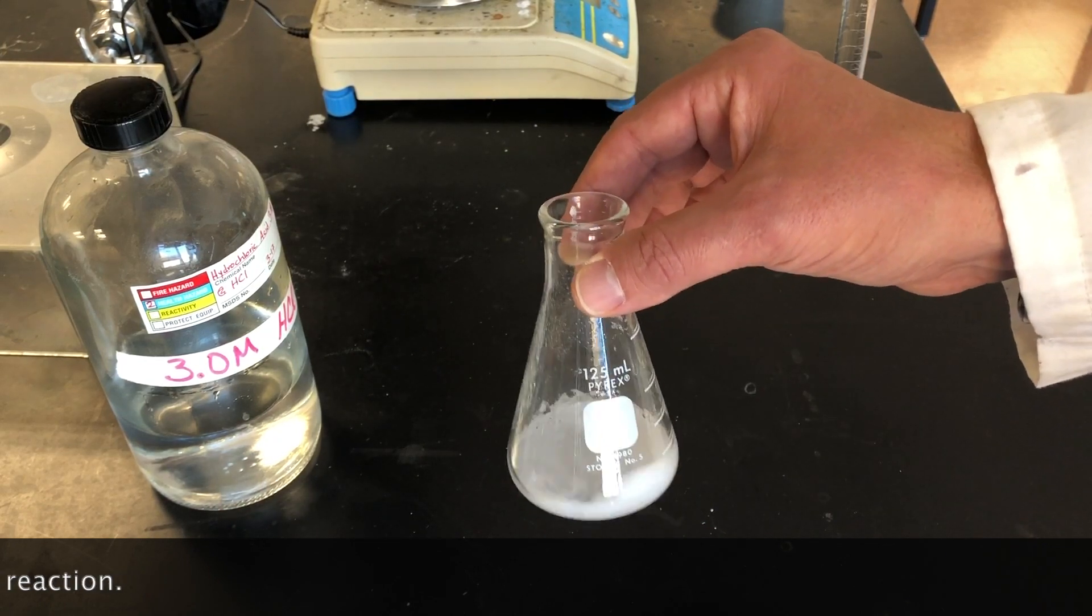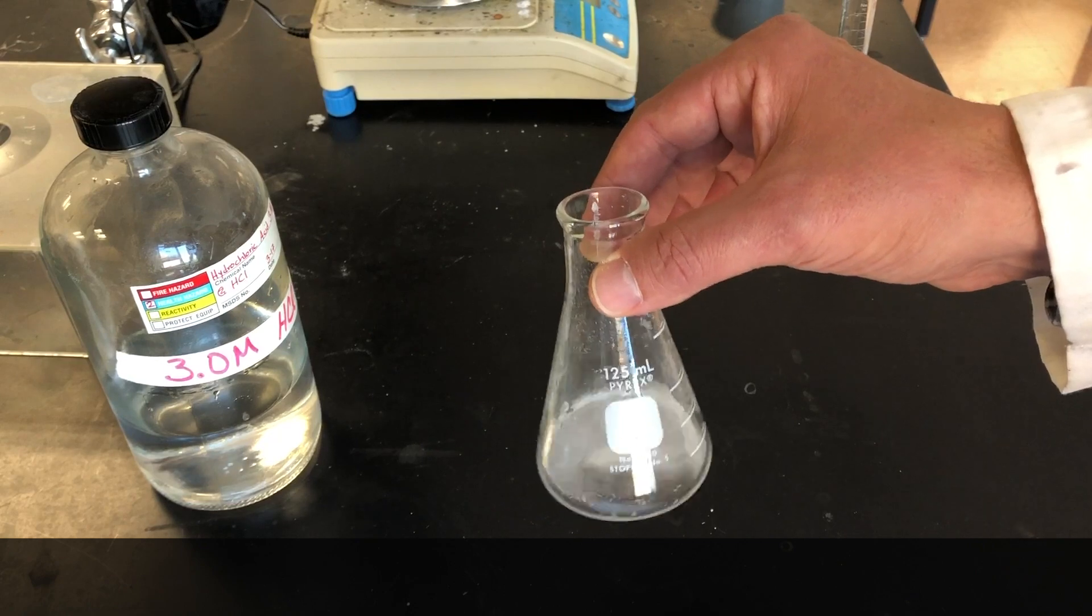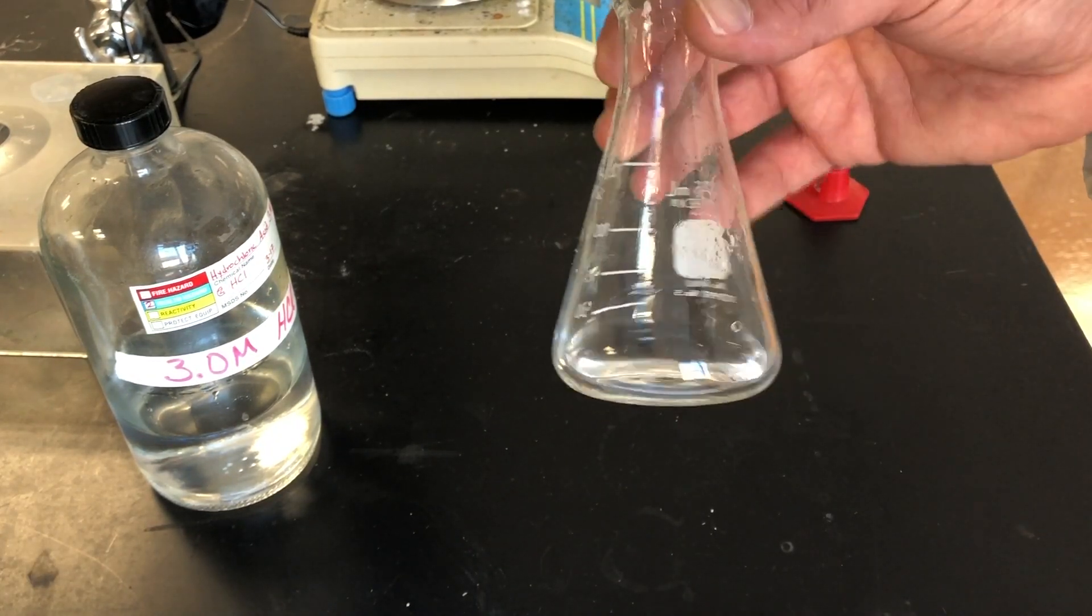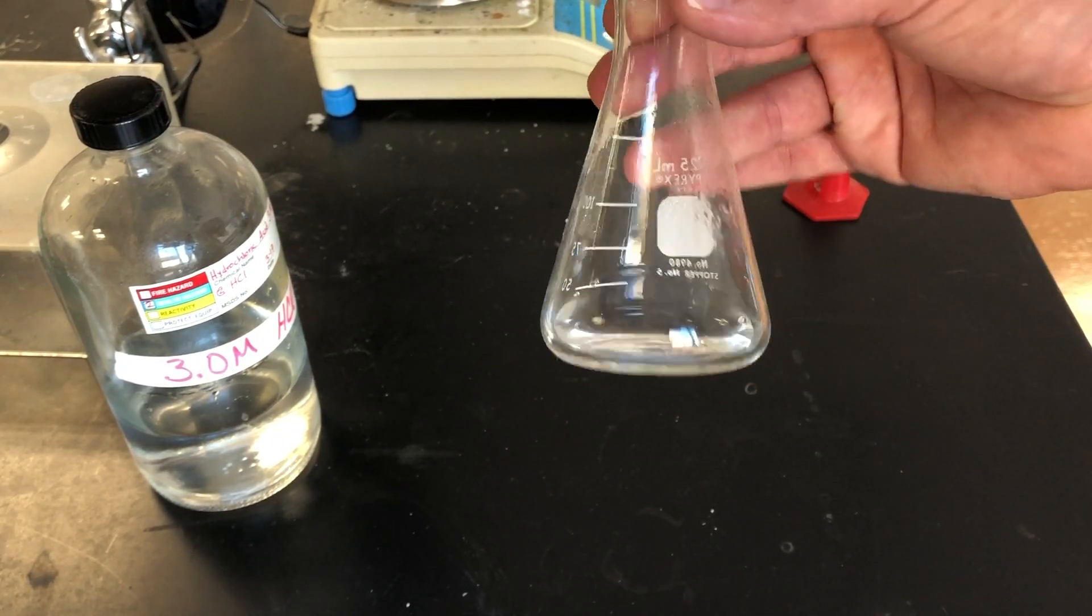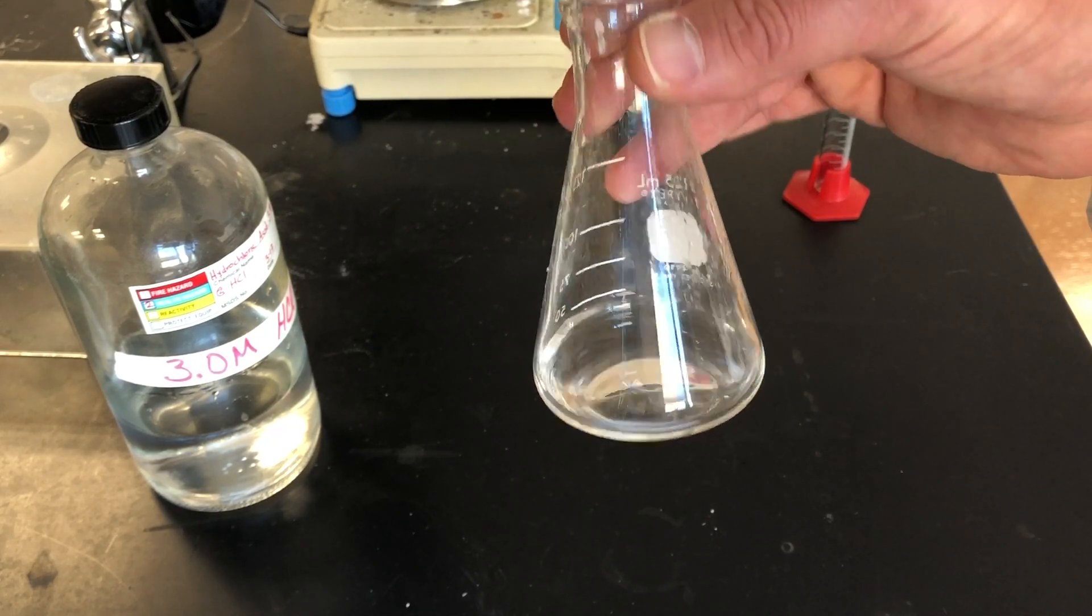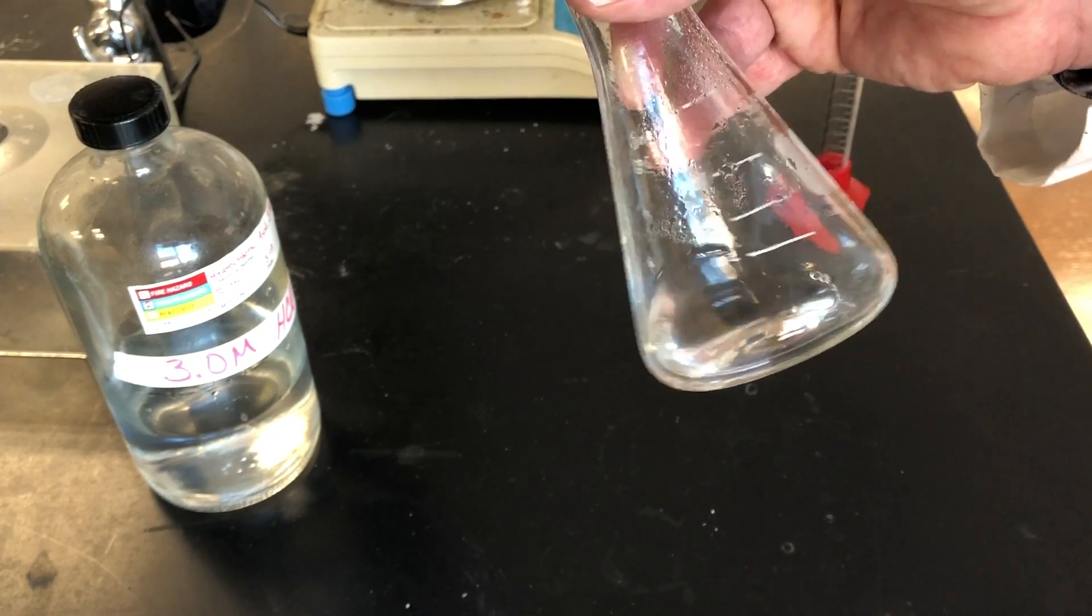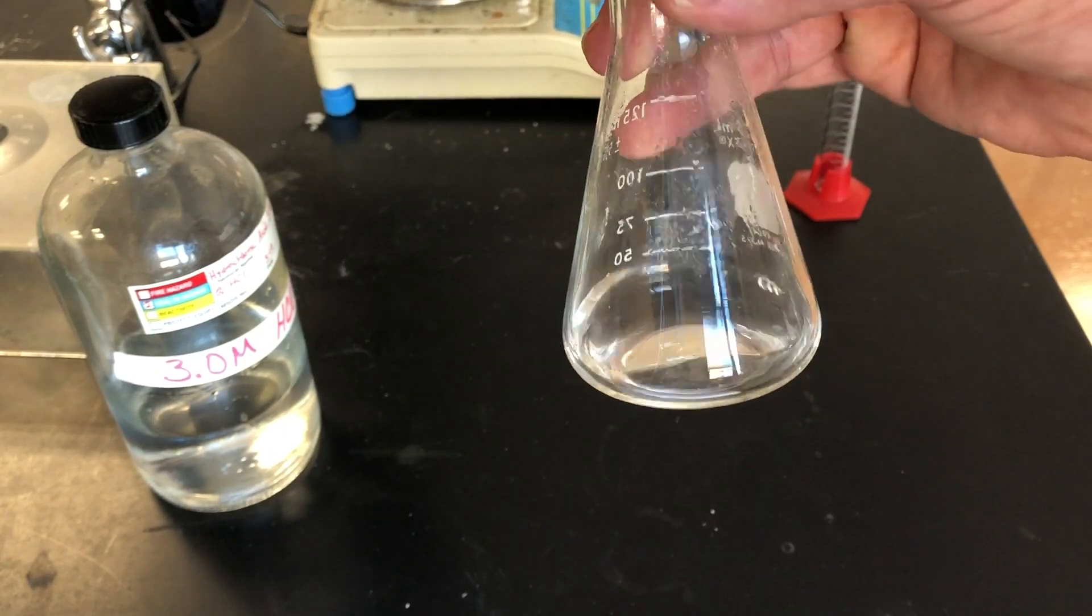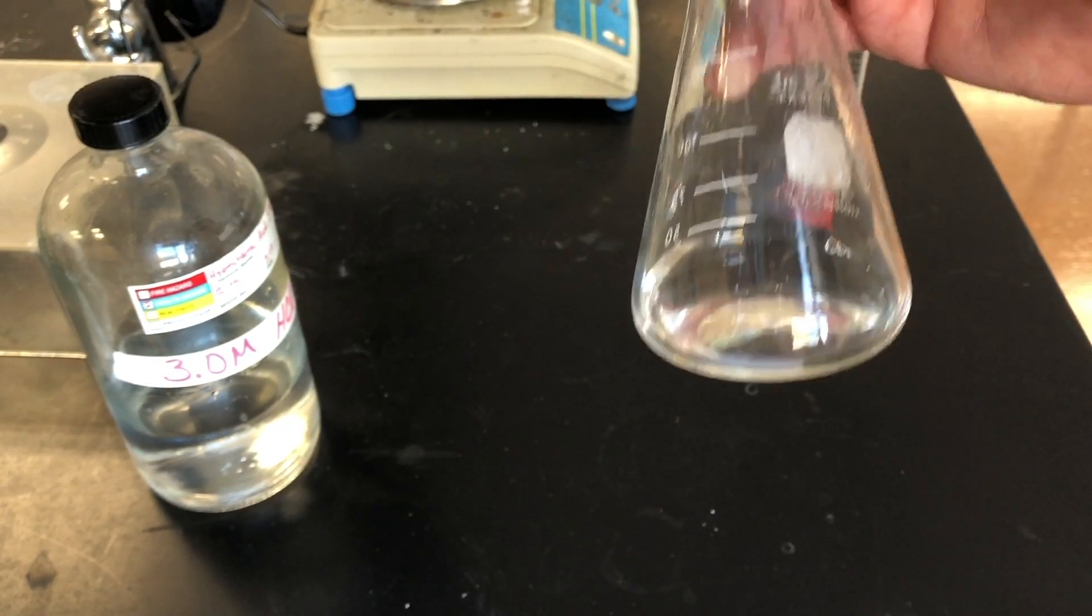Now we wait, swirling lightly, for the entire reaction to be over. Once the reaction is over, this is what's left. We have a clear liquid. There are no longer any signs of any chemical reaction happening in here. The reaction seems to be complete.